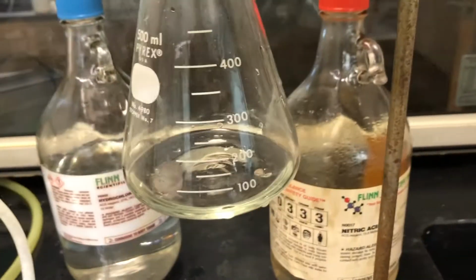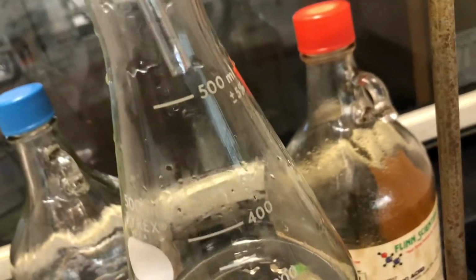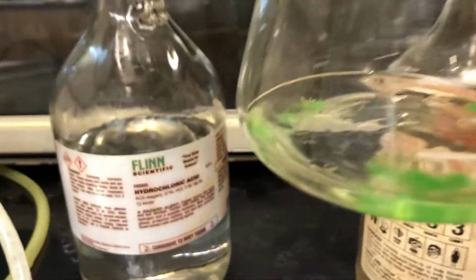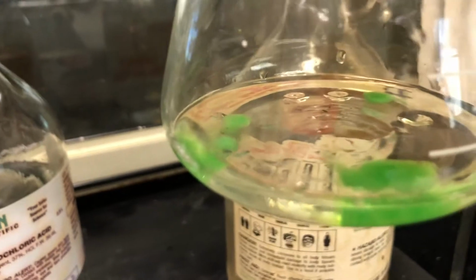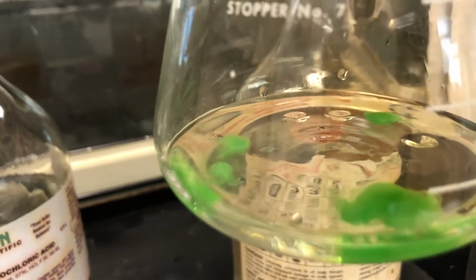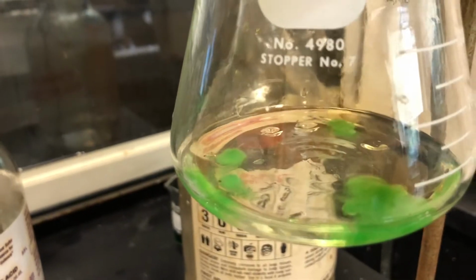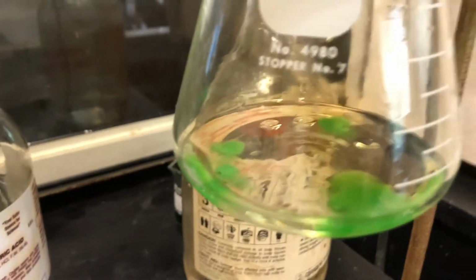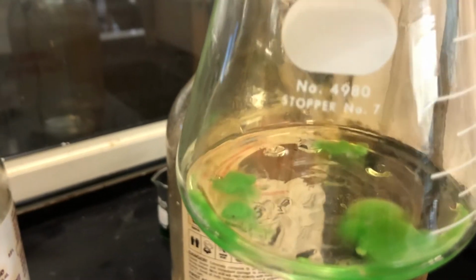All right, let's do the same thing now with our other concentrated acid, our nitric acid. So here we go. Put the copper in, and I'm going to stopper this. And you can see immediately we have a reaction. To zoom in the best that I can so you can see that. You're already seeing some really beautiful colors, and people who I taught chemistry last year, you might remember that's one of the things that I love about chemistry, the absolute beauty of it, the fantastic colors.